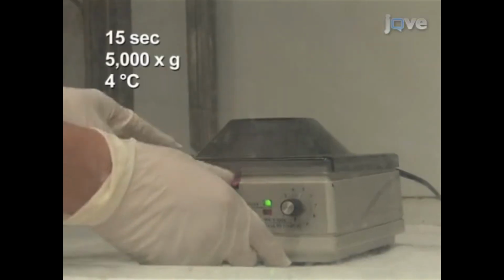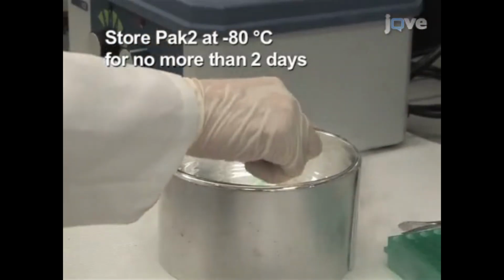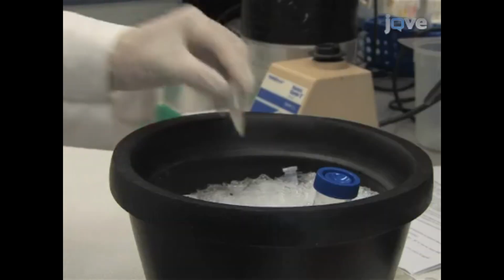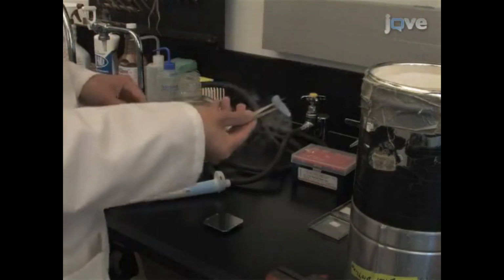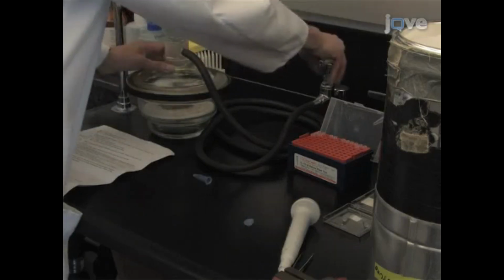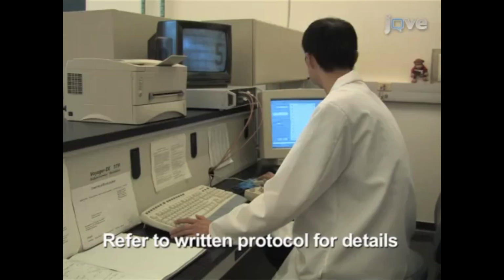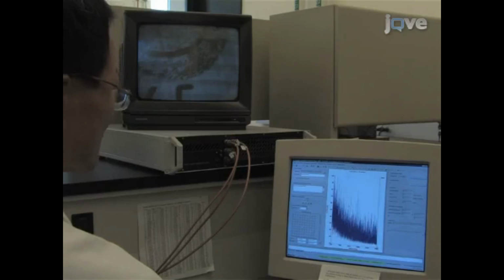Effectively terminate the digestion reactions by centrifugation to remove the pepsin. Rapidly freeze the samples in liquid nitrogen. For MALDI-TOF analysis, prepare the matrix and store at 0 degrees Celsius. Partially thaw each sample quickly. Mix 1 microliter of sample with 1 microliter of matrix. Then, spot on a 4 degrees Celsius MALDI target plate. 30 seconds prior to MALDI-TOF analysis, apply a moderate vacuum to the plate to dry the spots. Continue to acquire MALDI-TOF mass spectra. Average 100 scans in 2 minutes.